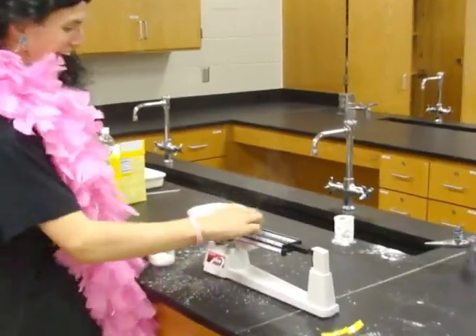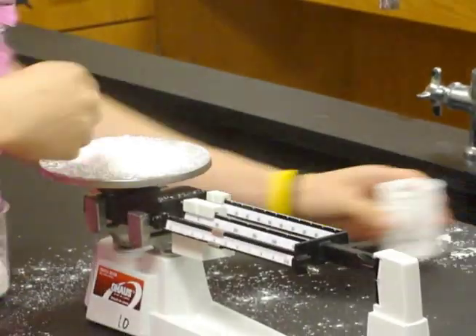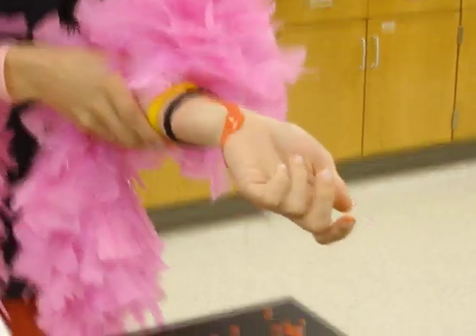Don't weigh directly on the balance pan. Clean beakers and wax paper are a better plan. A thermometer isn't a stirring rod. If you use it like this, your plan is flawed.